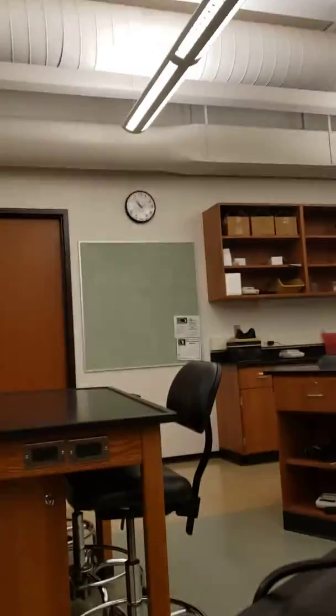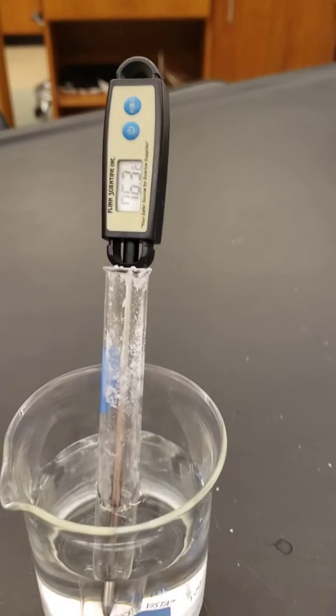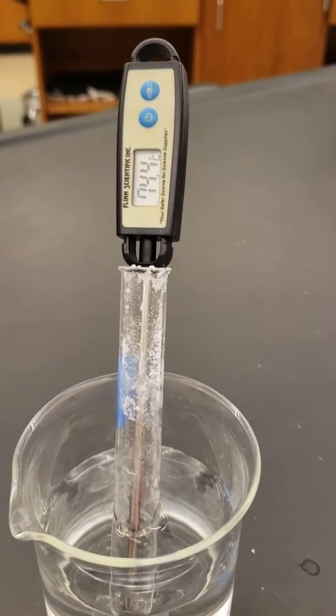Sorry, I've got to start my timer. Okay, I've started my timer. 80.2 for my initial reading.